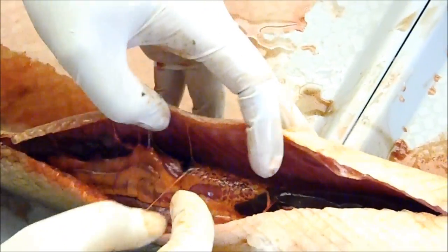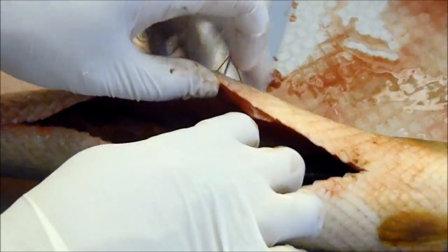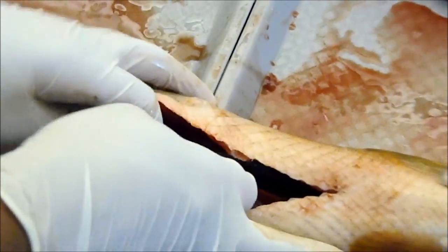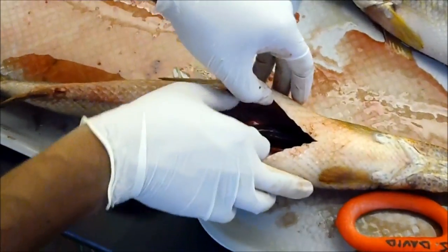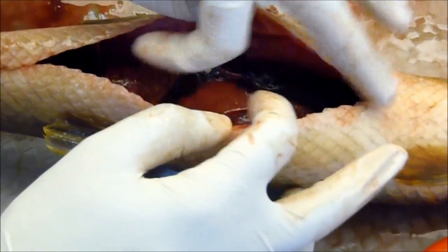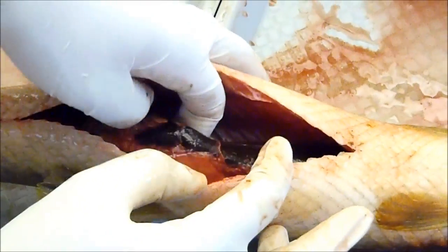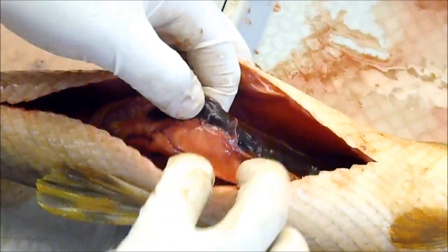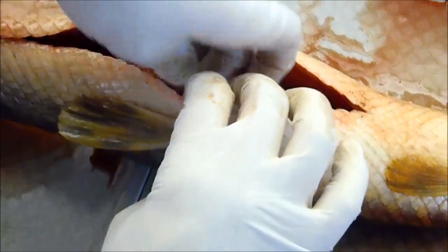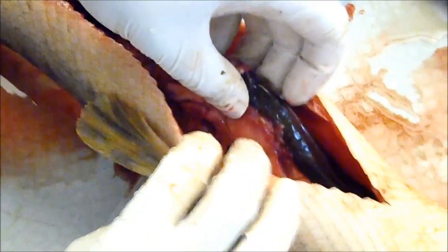As we can see, this one appears to be a male. There's very little in terms of ready-to-go gonads because these fish were caught after the spawning season. But you can see that we have testes as opposed to the ovaries we would see in a female. The dark structure running here is the liver, and then here is one of the testes. The gamete release pathways are the best way of identifying the sex of the fish, in case you can't see the eggs.